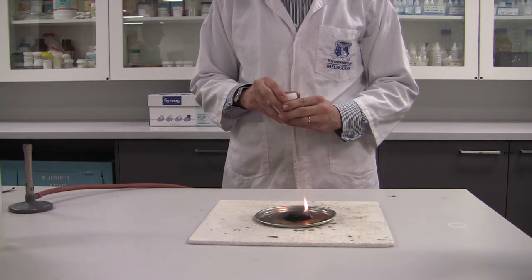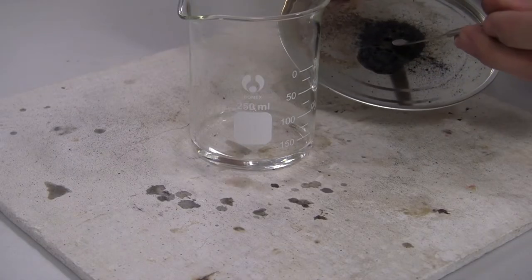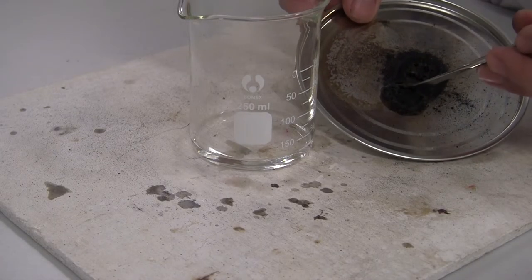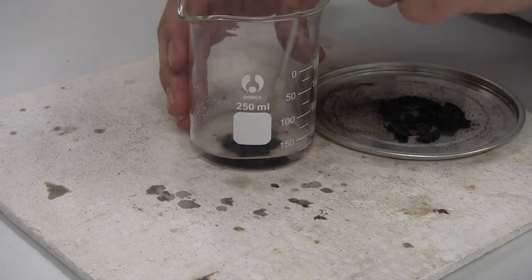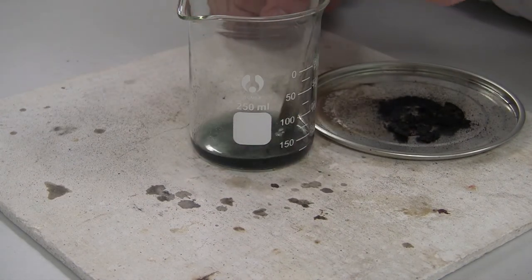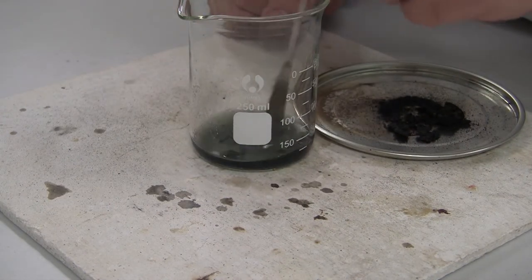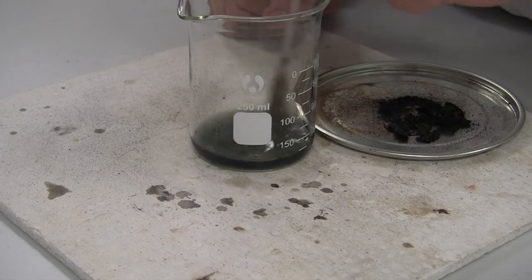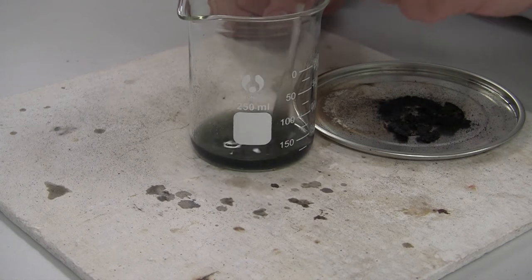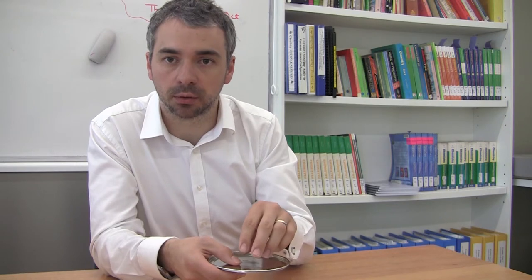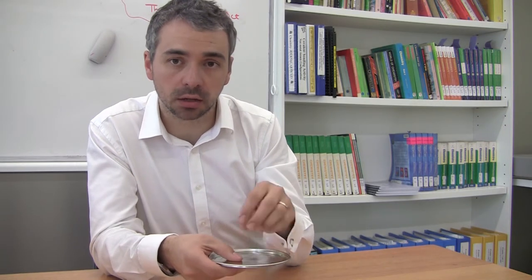You get a brown residue forming on the tin. If you get the brown residue and put it into some water, you'll actually see that the water turns green and there's still a brown residue. Take some of that brown solid and drop it in some water and they get a nice light green solution as well, signifying the presence of both the manganese 4+ as the solid but also the green manganese 6+.